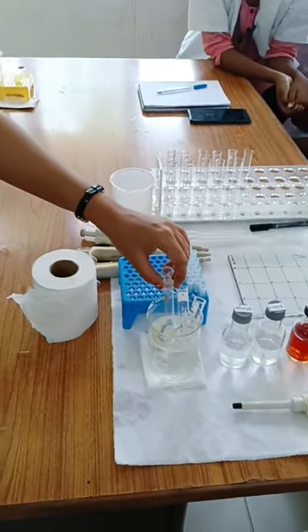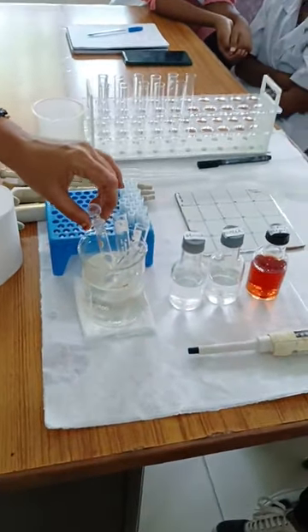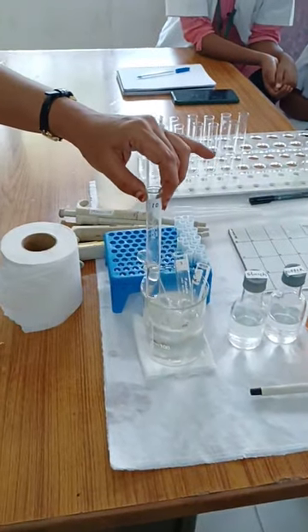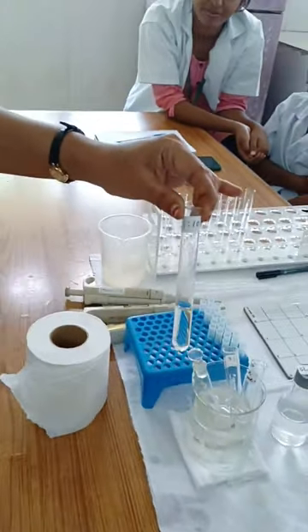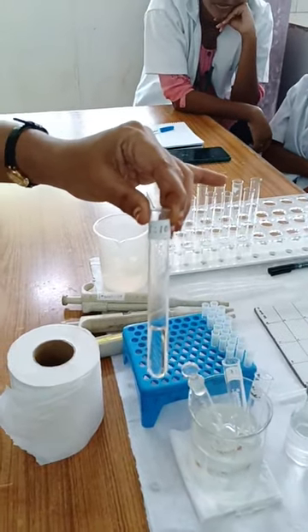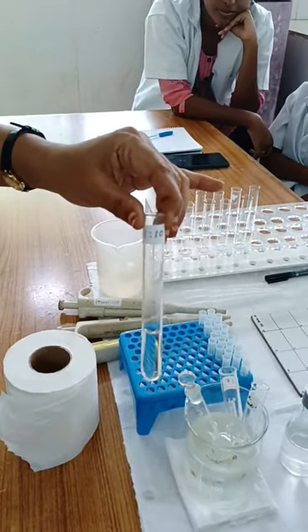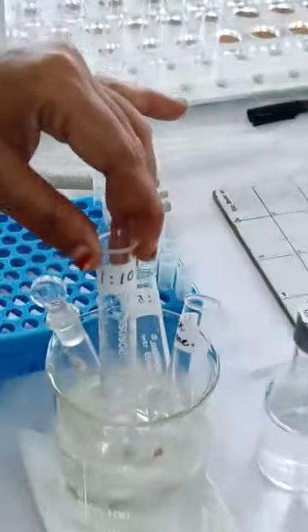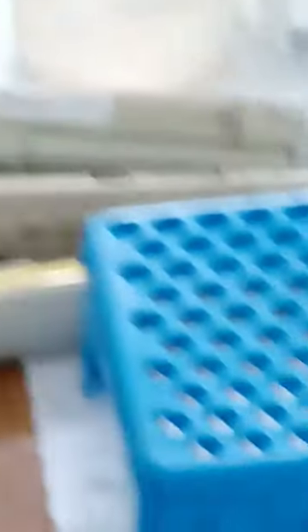We are taking the stock enzyme but we are not going to use it directly — we are going to dilute it. A 1-in-10 dilution has been done: 1 ml of enzyme was taken and diluted with 9 ml of phosphate buffer, and it is also placed inside ice. Now we are going to prepare the reaction mixture. Our students — BSc and NDC students — are going to perform this experiment.